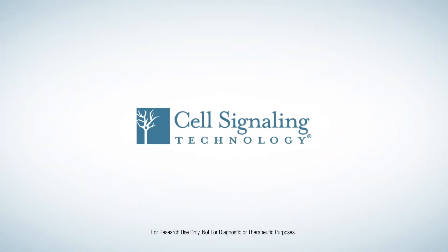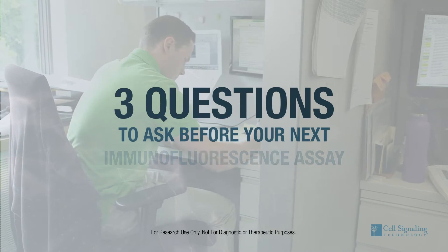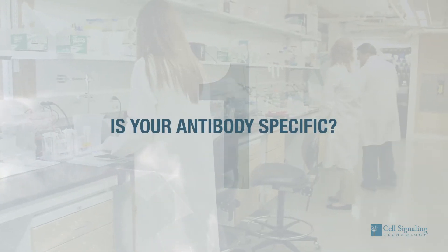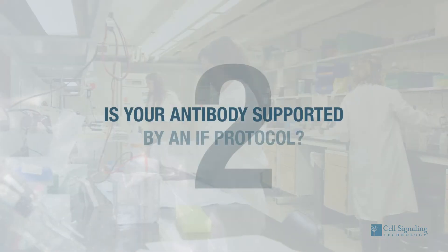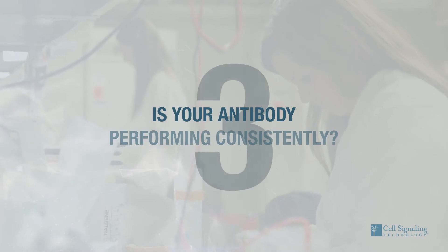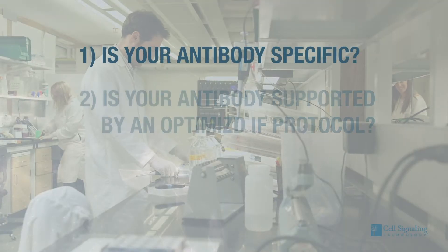Before starting an immunofluorescence experiment, you should ask yourself the following three questions: Is your antibody specific? Is your antibody supported by an optimized IF protocol? Is your antibody performing consistently? Let's take them each in turn.